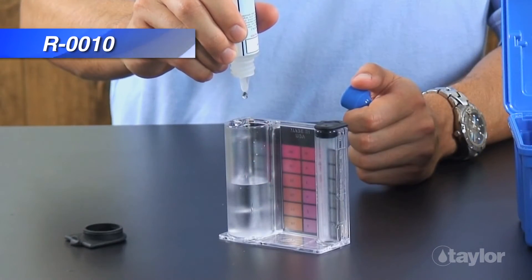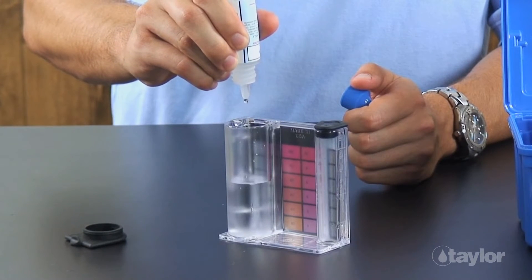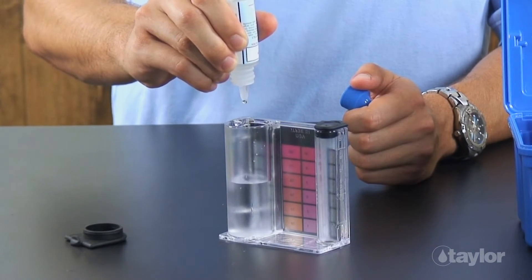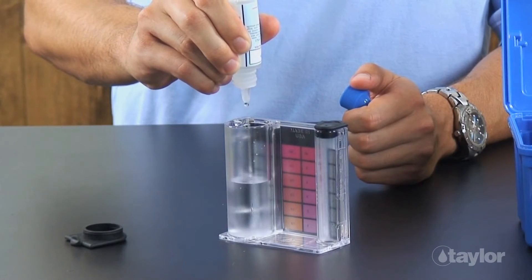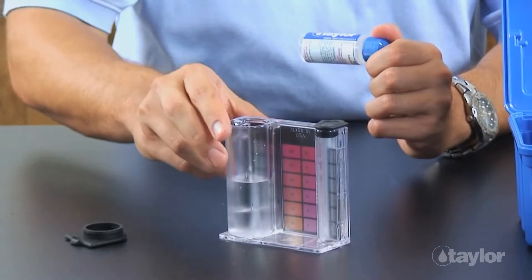Add 20 drops of reagent 10. Swirl to mix.